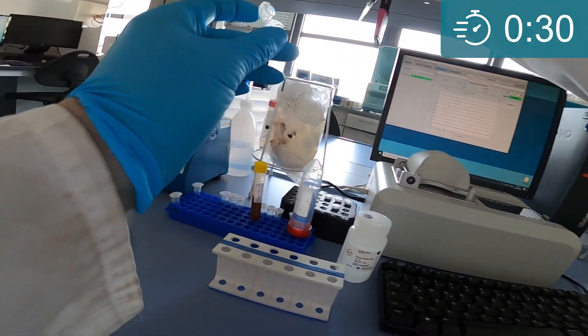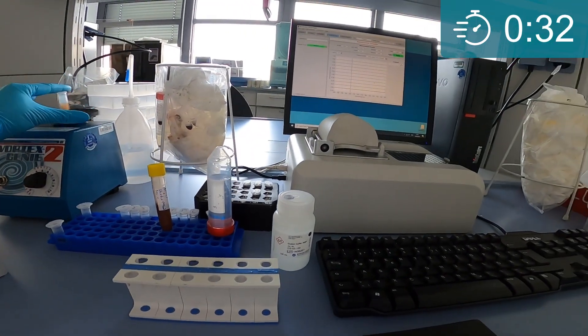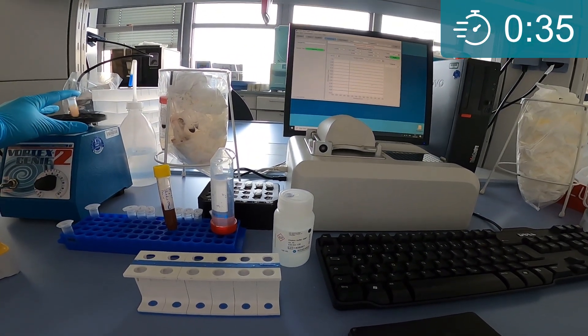Mix the sample for a minimum of 30 seconds. You can use a vortex or a shaker for the mixing action.